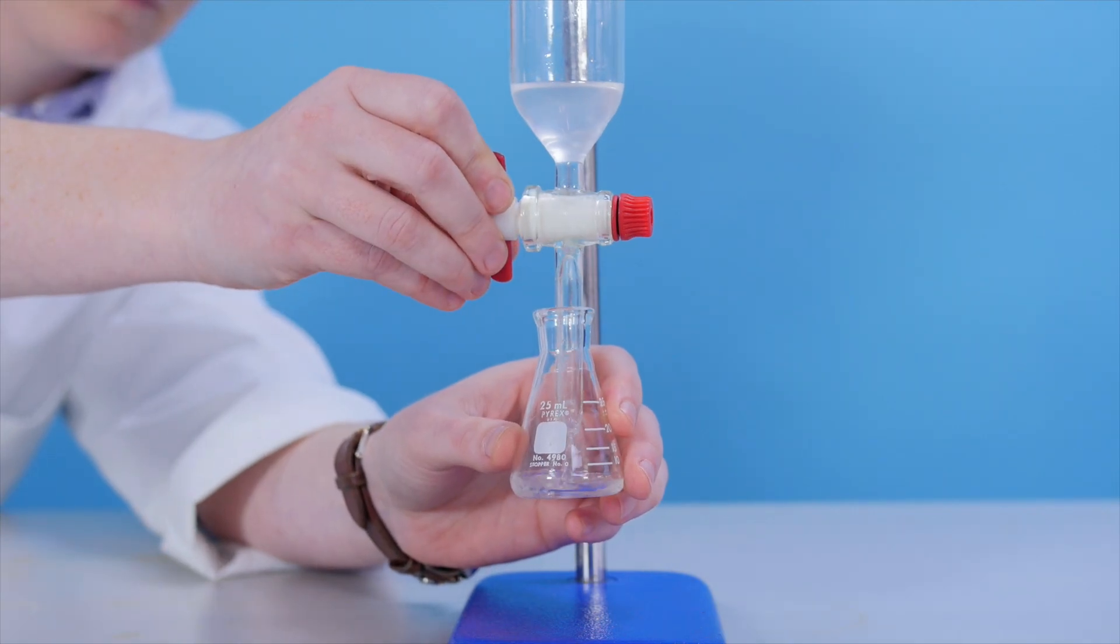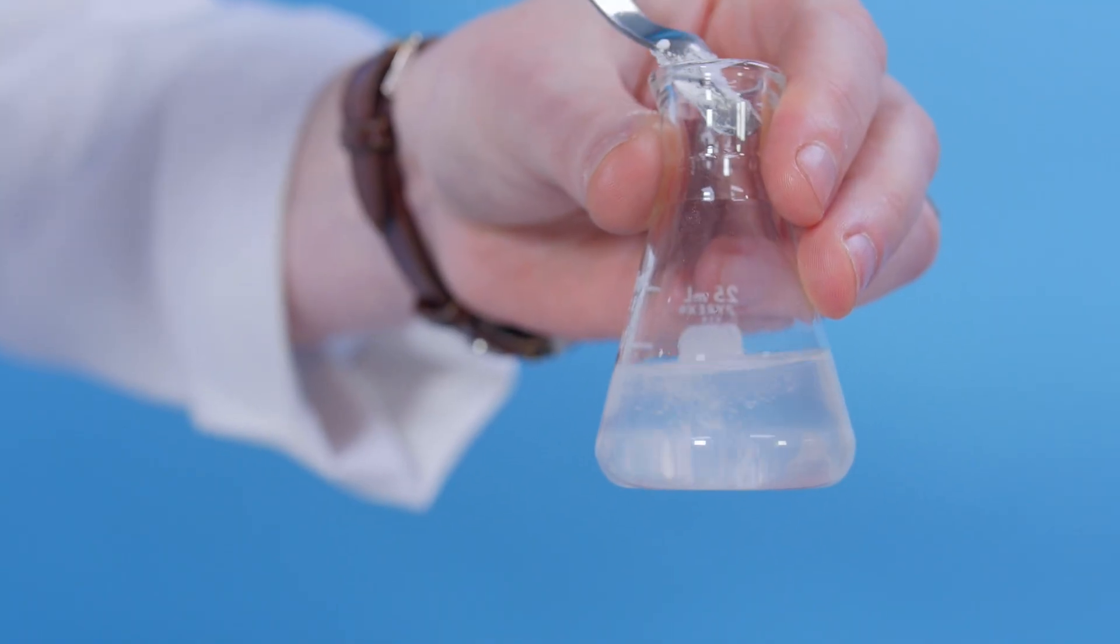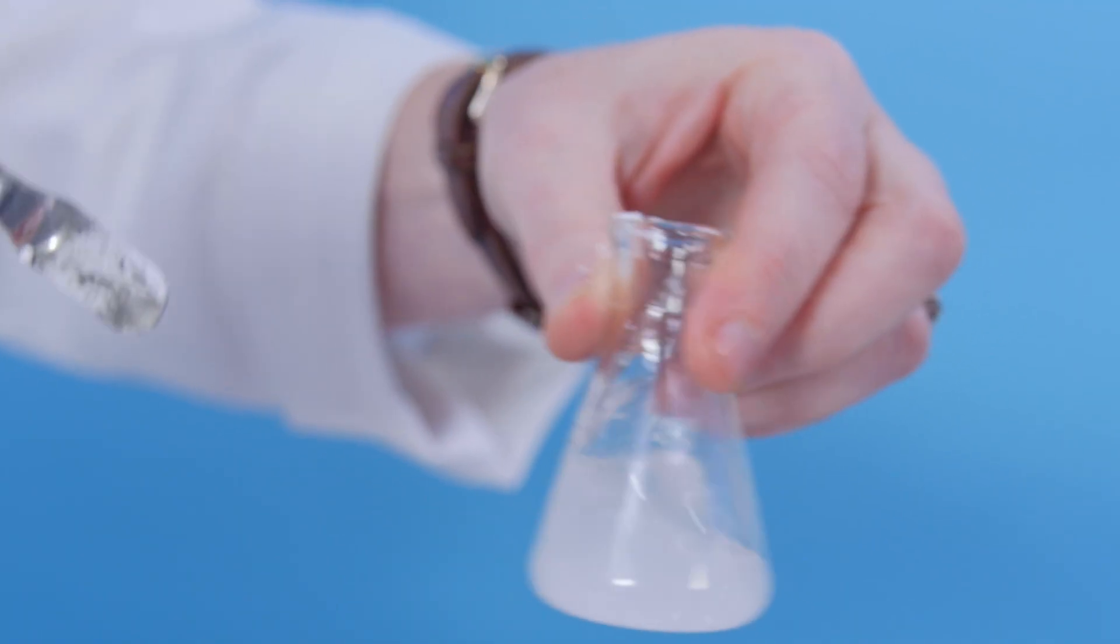Transfer the product to a small conical flask. And then add calcium chloride to dry the mixture.